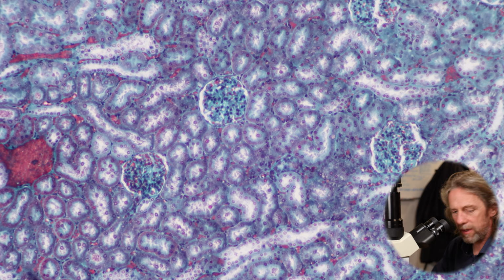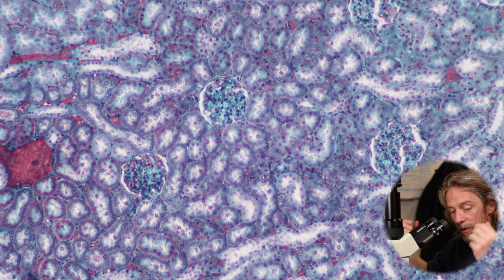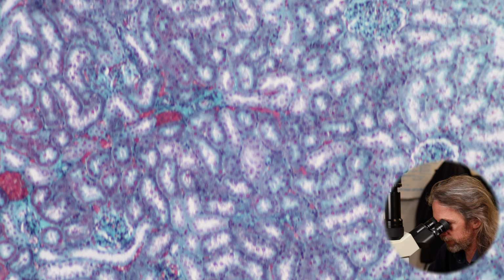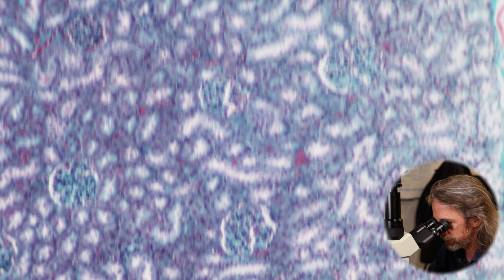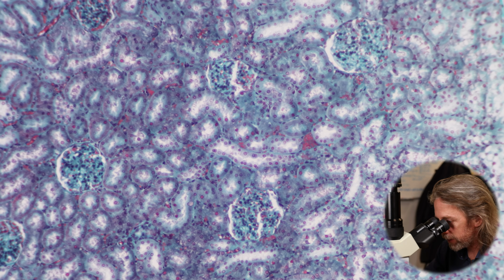And we're seeing these dotted around. So there are 2 types of nephrons. There are nephrons out in the cortex, and there are nephrons next to the medulla, juxtamedullary nephrons. I mean, they're not really different types, in different places anyway. I'm going to refrain from doing too much detail, and we're going to spend time looking and describing and understanding, all right? Because the physiologists can talk so much about the functions of the kidney already. Anyway, right, so you see we've got a number of glomeruli here.